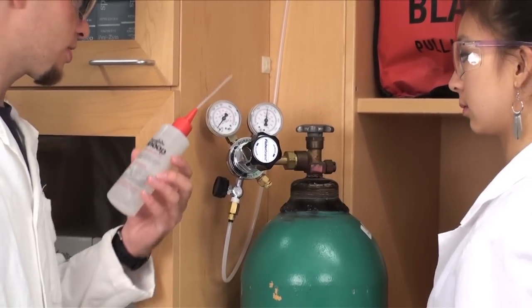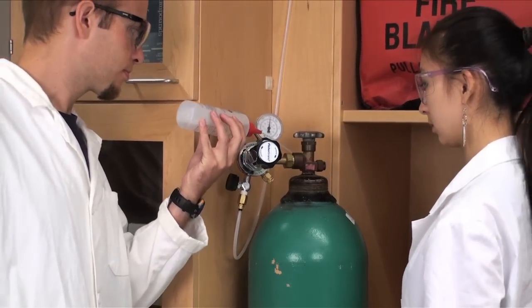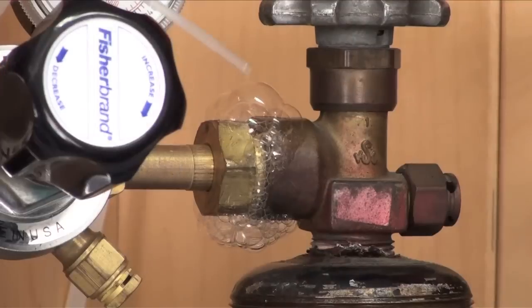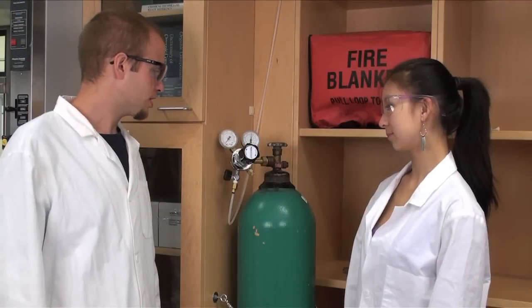Okay, let's check the connection for leaks. It looks like it's leaking. Okay, let's retighten it.